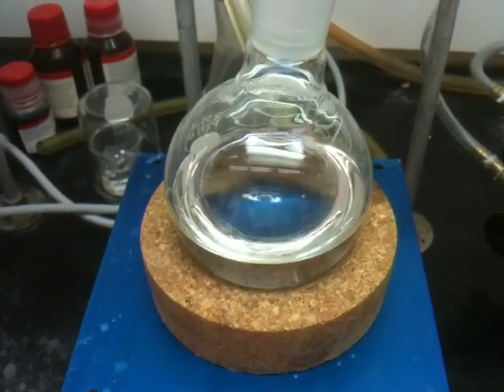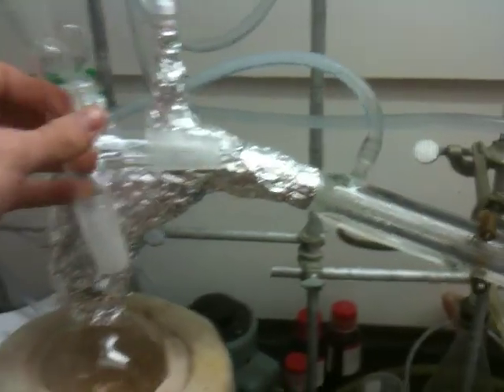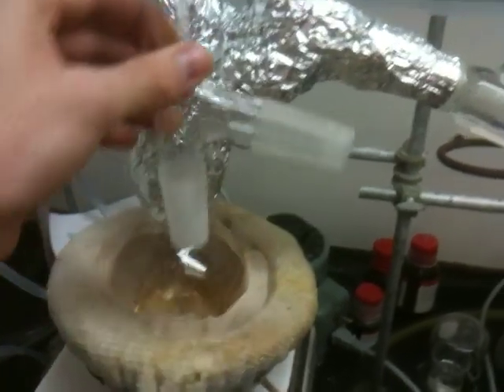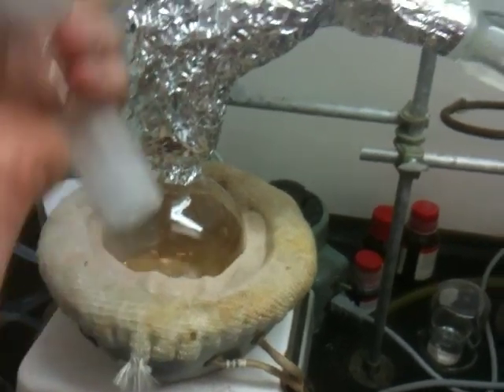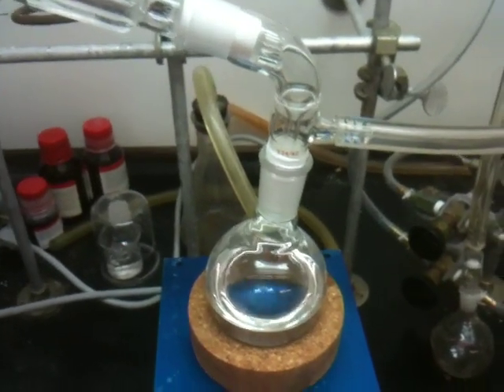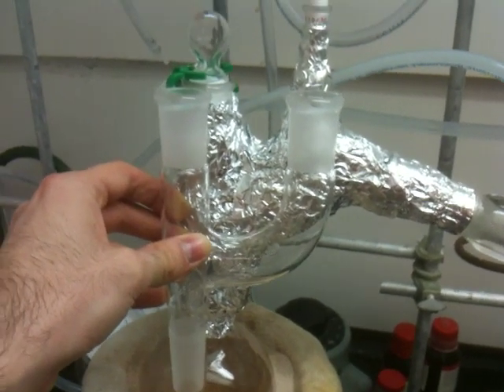As you can see, it is completely colorless solvent. A slight modification I've done: previously I used to have one of these distillation adapters, so the thermometer is on top, the right one goes to the condenser, and the bottom one is attached to your flask. But the problem is if the vacuum is too strong or the temperature increases, everything bumps and everything is transferred to your collection flask and you end up with impure solvent. But this time I'm using the Claisen head, which avoids that scenario.